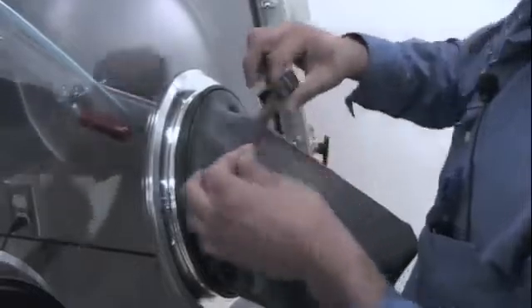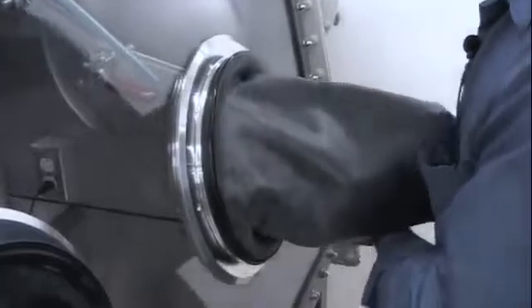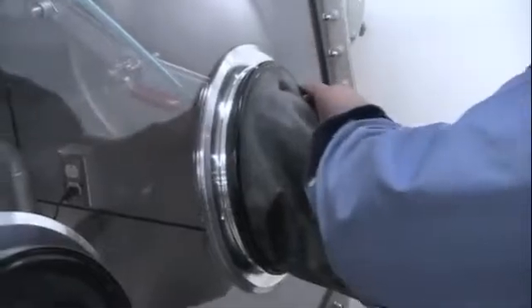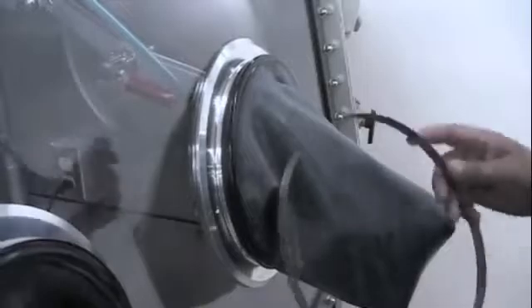Followed by applying some electrical tape. In this process I like to stretch the tape as I apply it, and two to three layers of electrical tape should do the trick. We then install the glove clamp and secure everything in place by tightening it down.